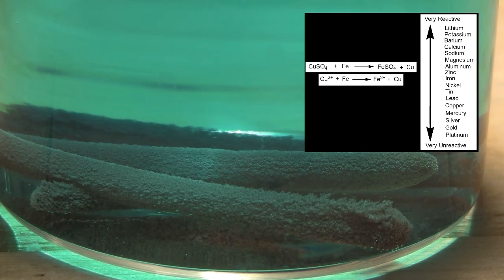An additional note for why the zinc coating needs to be removed for this reaction to work is that despite zinc being more reactive than copper, a copper coating will form instead based on my previous experience with this reaction. The way around this to form a more pure product was to add hydrochloric acid.